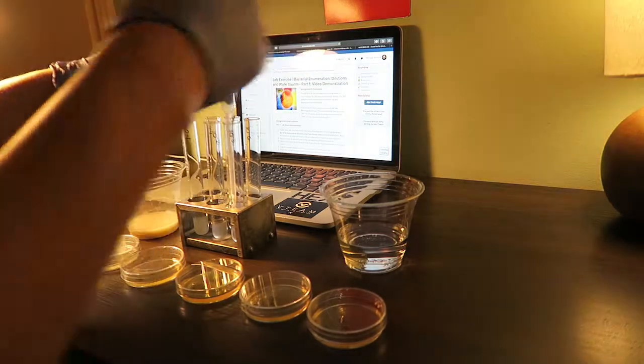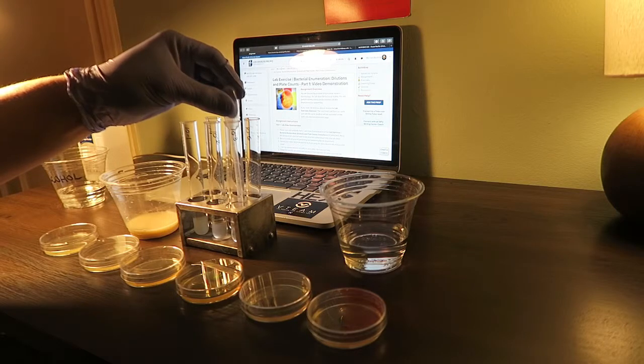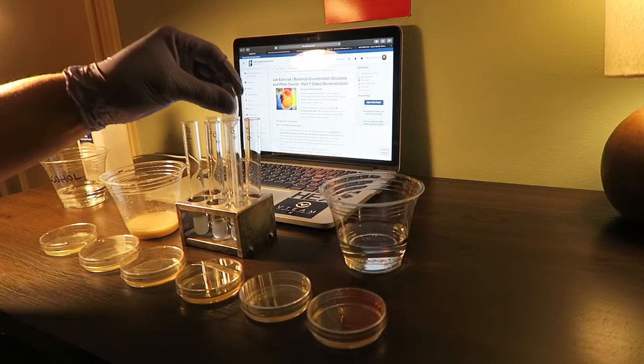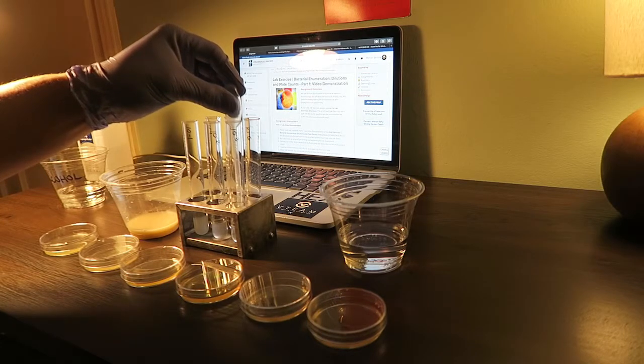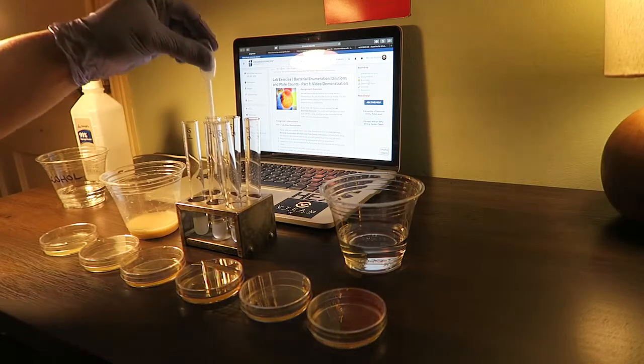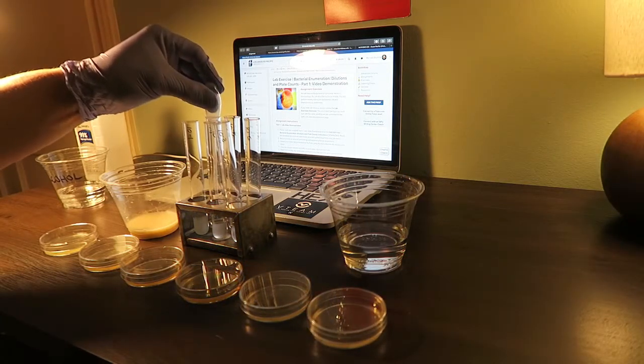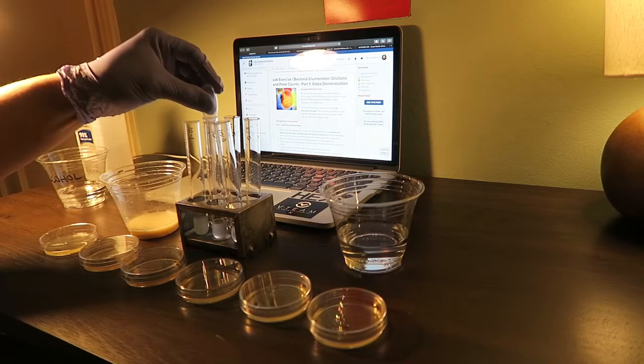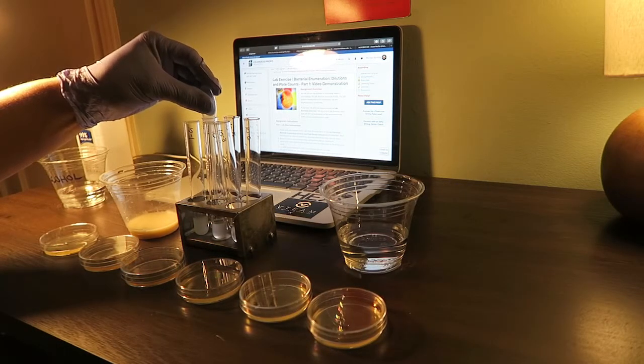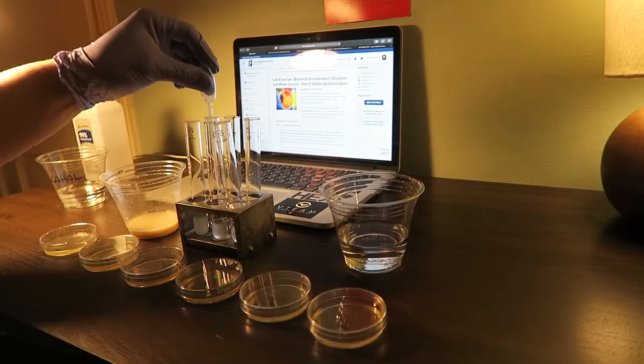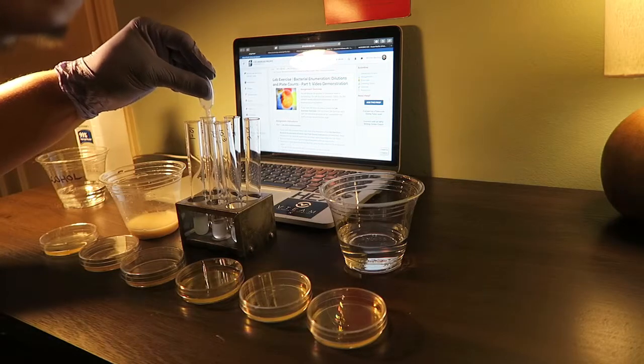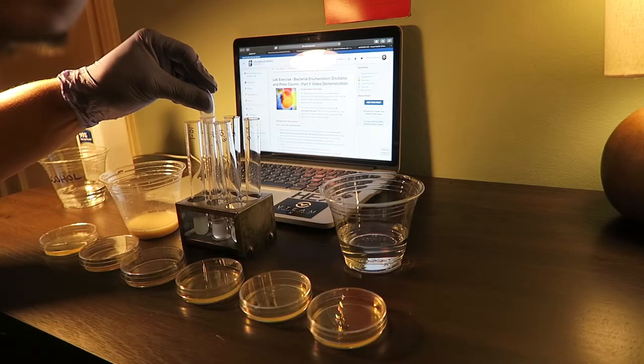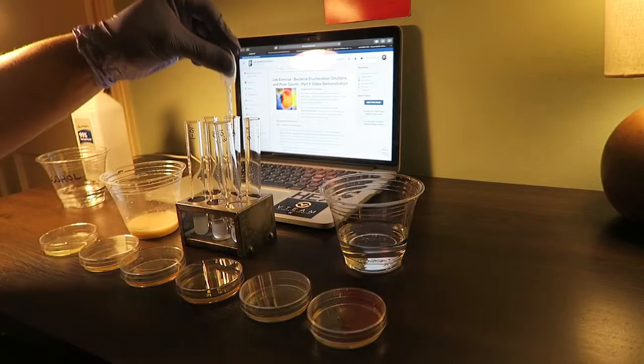Putting it into tube three, making sure that is all squared away. Then I'll grab 0.25 ml from tube three and put it into tube four.